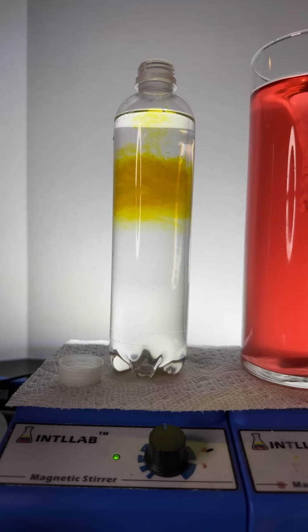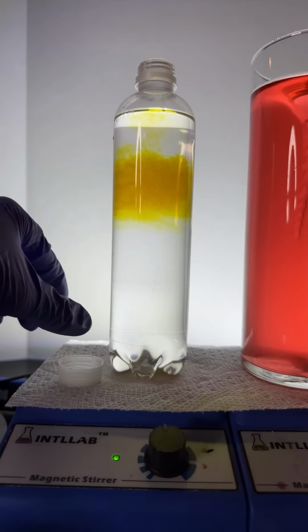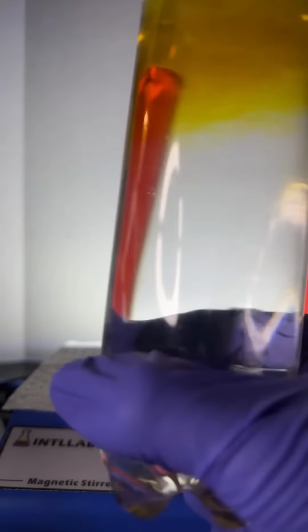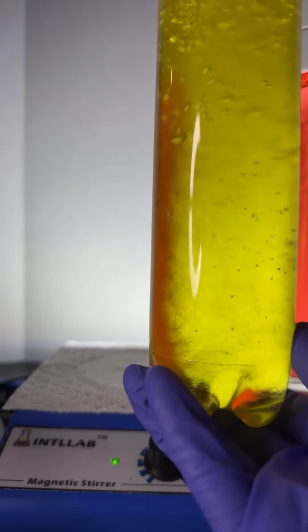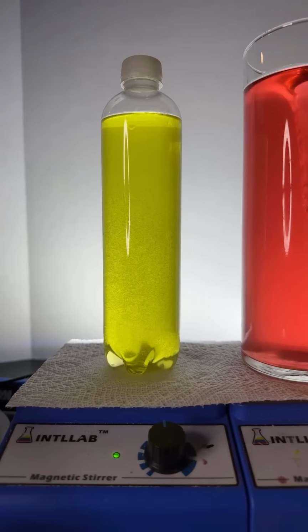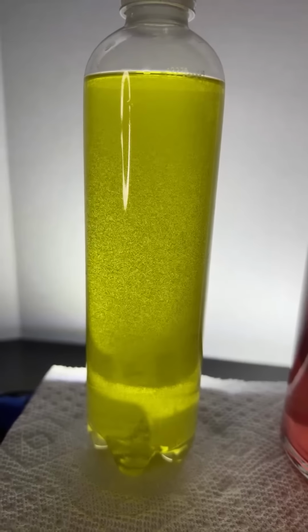Let's see if we can make a mix. Absolutely, Hunter and James, it is because of density effects. The alcohol that I added is going to be less dense than the water. And so there's two layers there, but we can make those two layers mix. Here we go. At least I think we can. Let's try it. Mix that up, and if it gets yellow all the way through, we know that indeed the alcohol and the water mix. Look at those bubbles too. All those bubbles are kind of cool.